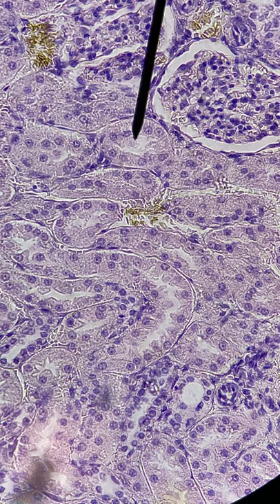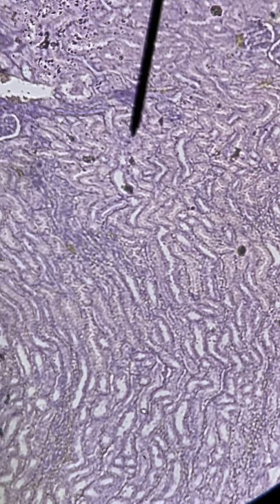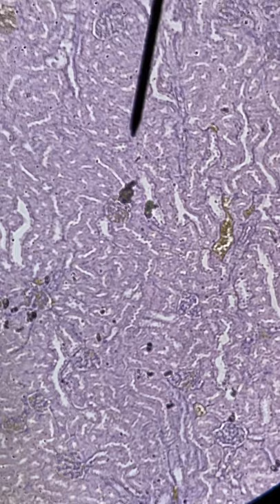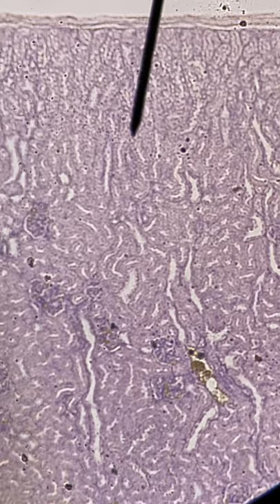Right here by the border of the medulla, these would be juxtamedullary nephrons, because you can see that those corpuscles are only a very short distance from the medulla. But if I go way up here, getting farther away from the medulla, even right next to the outside, you're going to find lots of cortical nephrons. And as I mentioned, there are many more cortical nephrons than there are juxtamedullary nephrons.